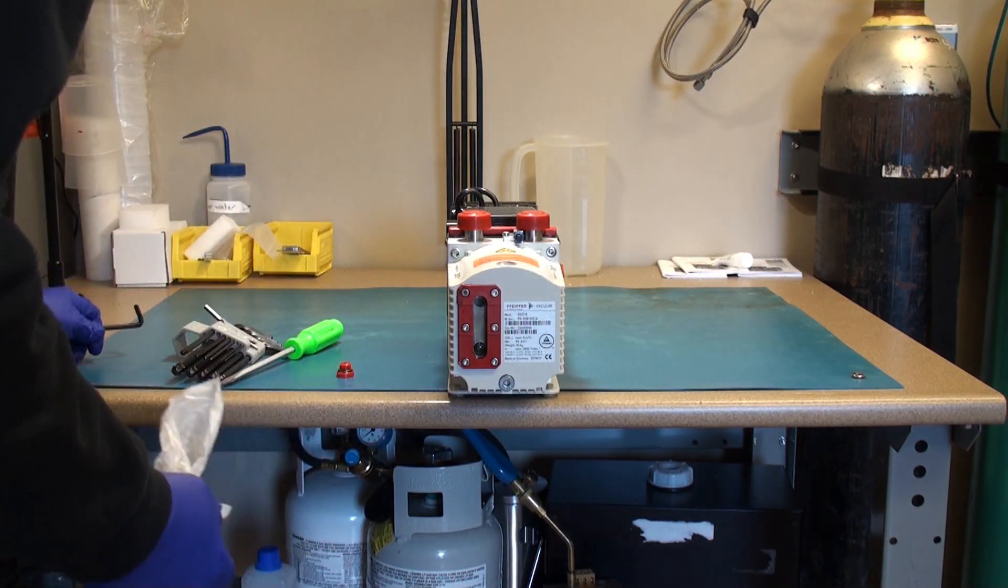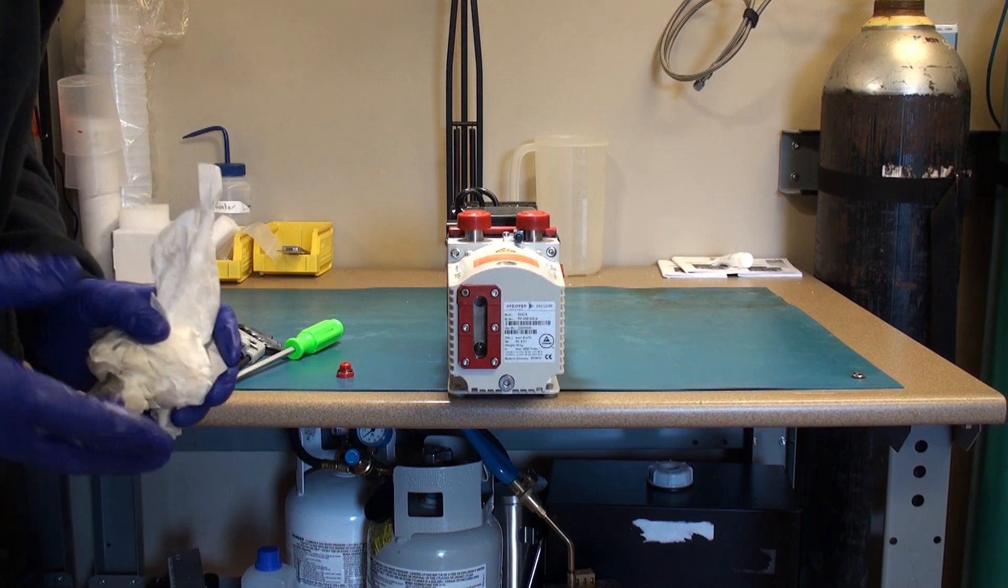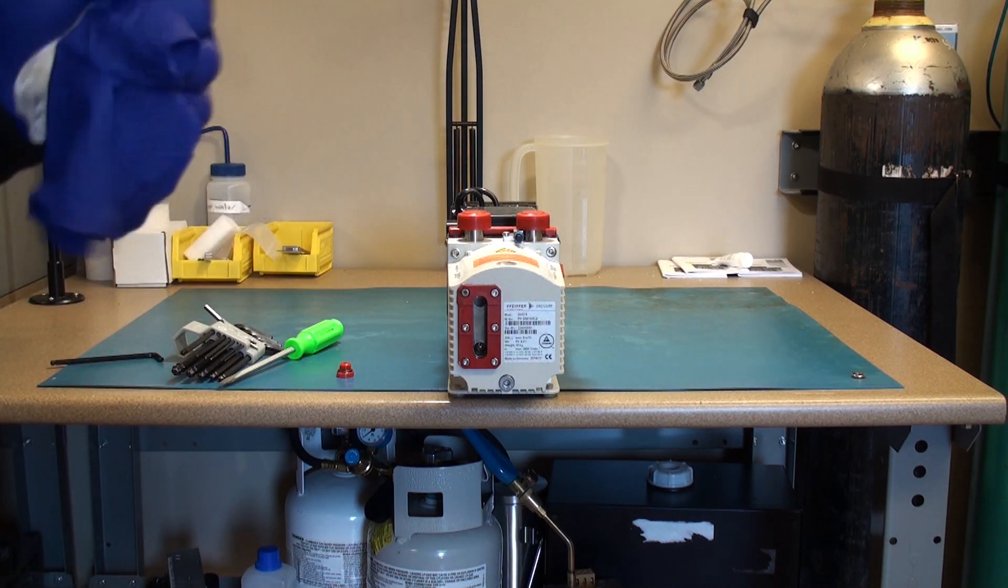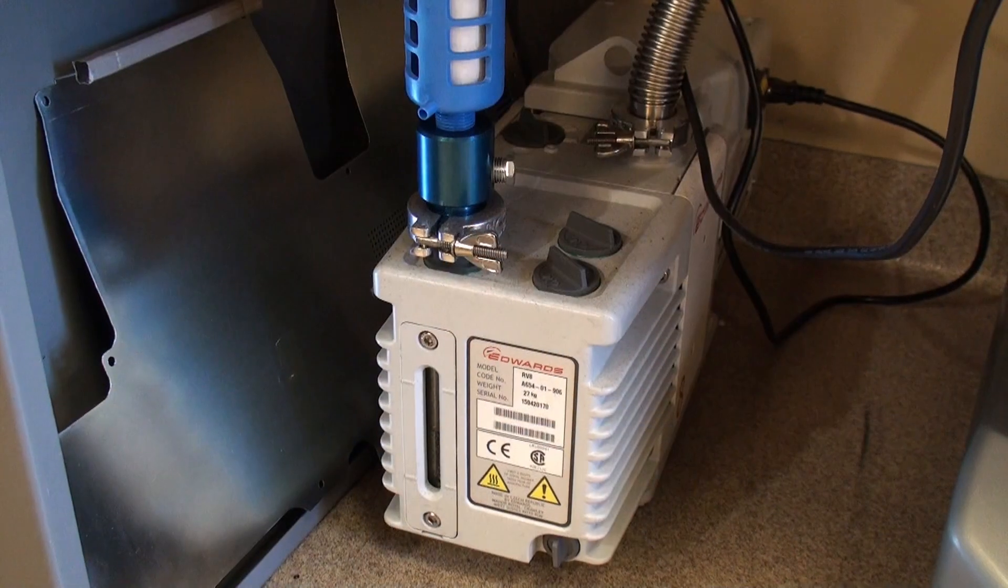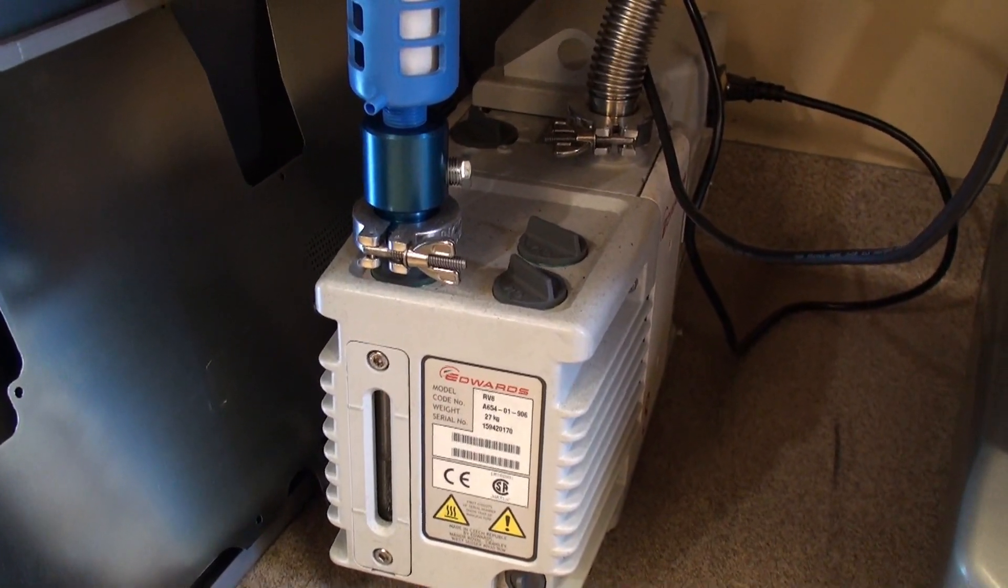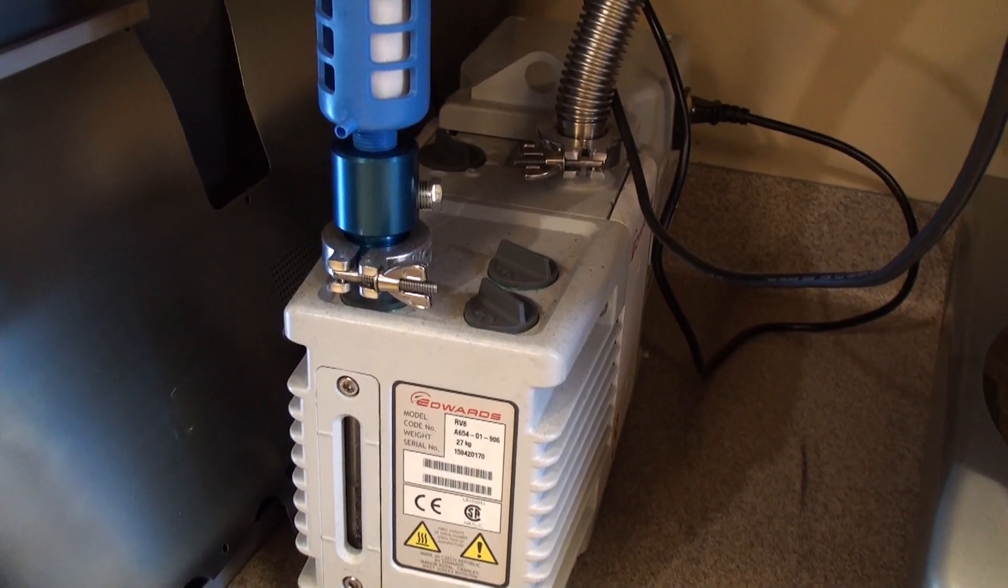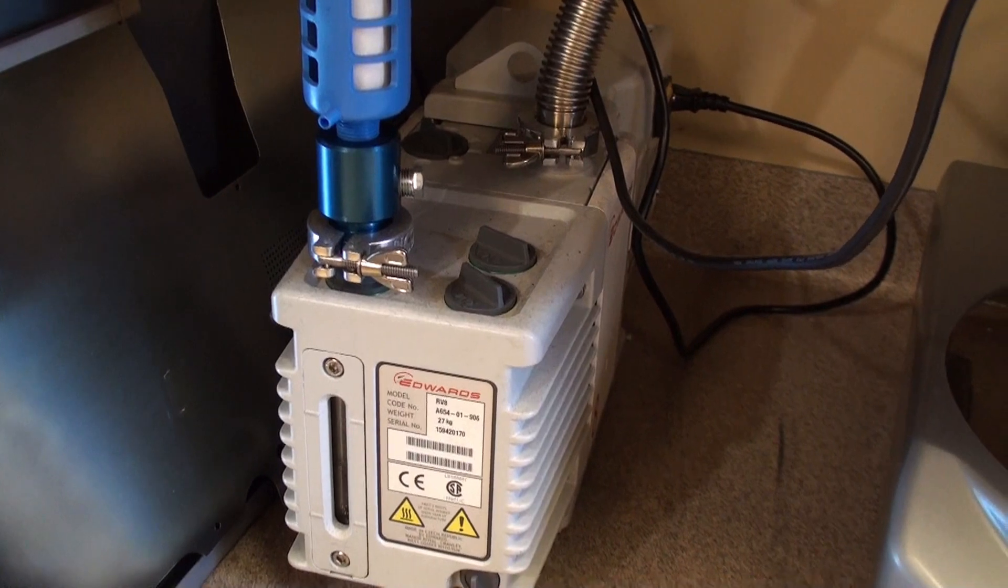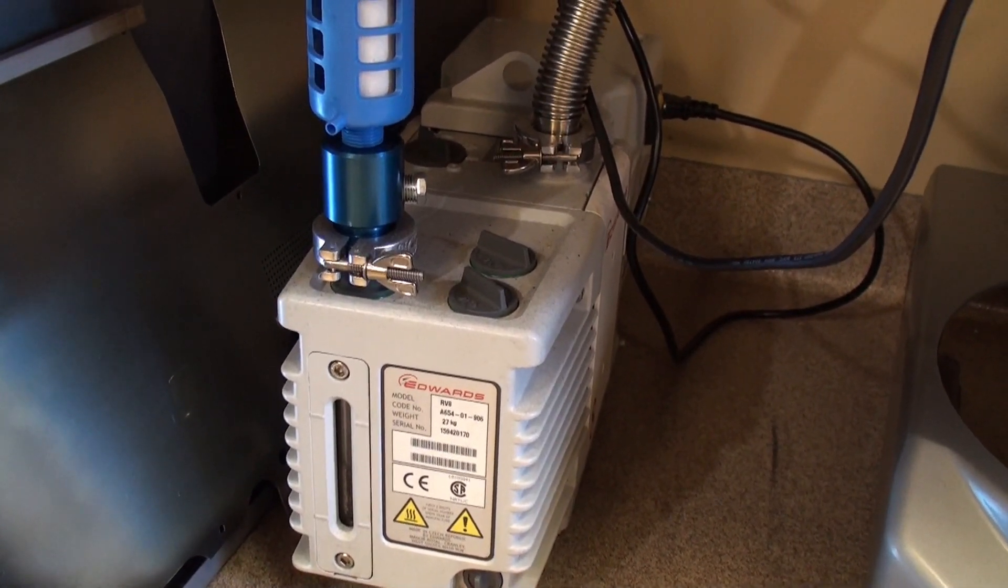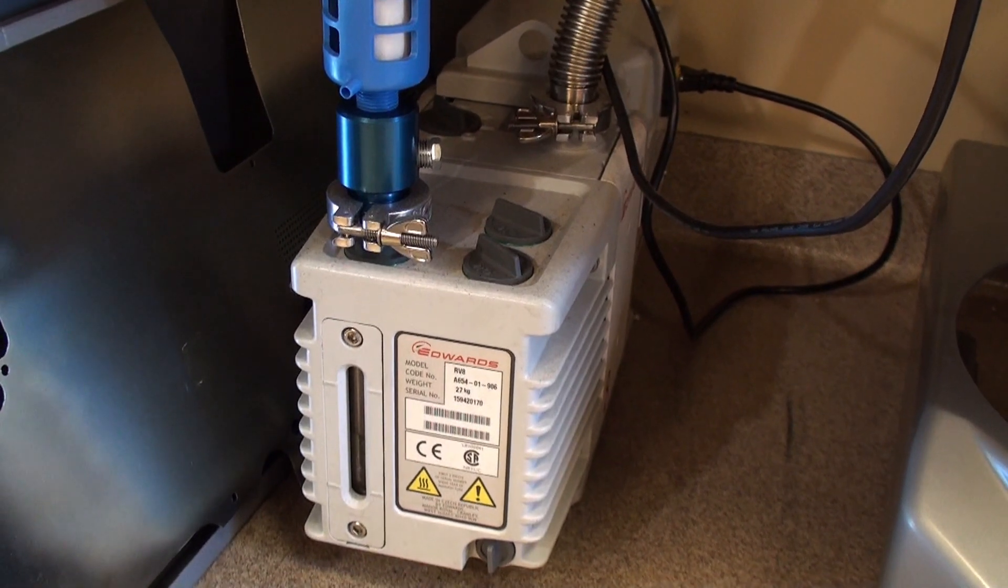And then I will add fresh oil. This happens to be an Edwards pump, an RV8. Doesn't matter, RV3, RV5, RV8. The process for oil exchange and replacement on a routine basis is the same.